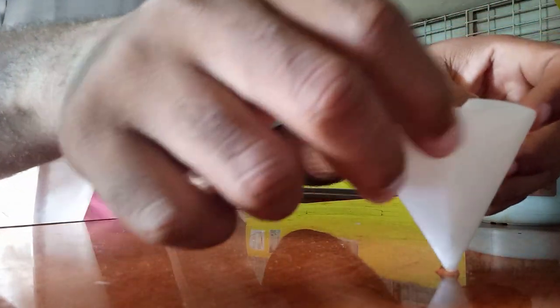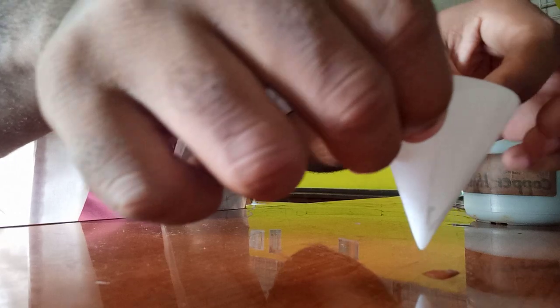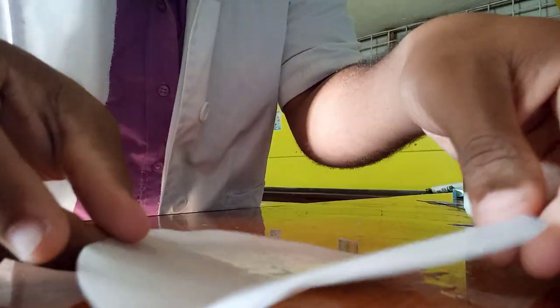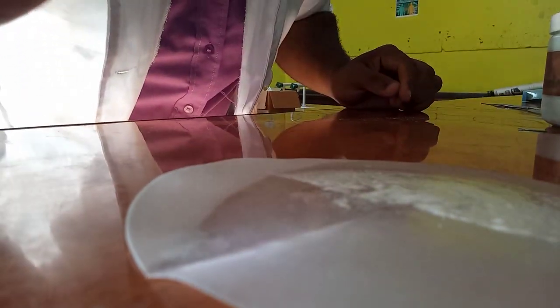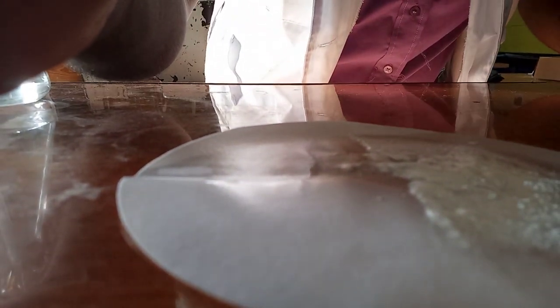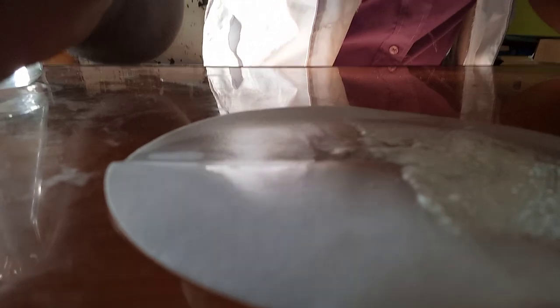Now I will show you the white precipitate of lead bromide. All we do is allow it to dry, and that is your white precipitate of lead bromide. That's how you can prepare an insoluble salt.